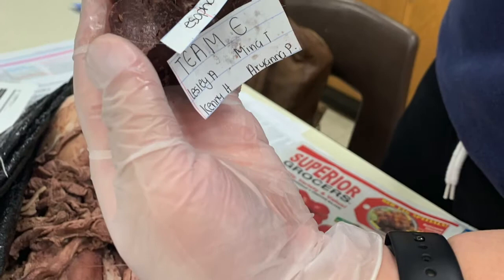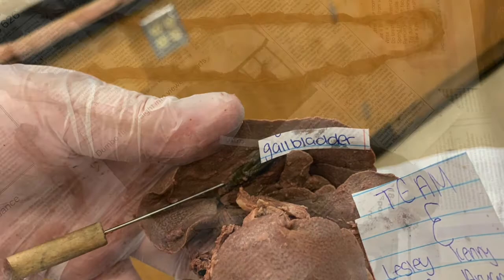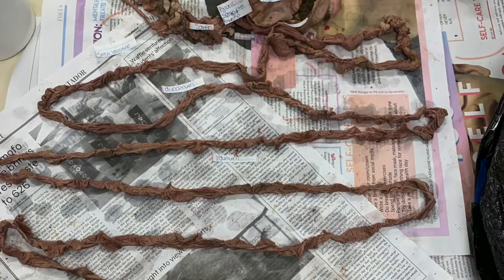The esophagus's function is to move food down from the mouth to the stomach. The liver functions to regulate blood glucose, break down fats, protein metabolism, store vitamins, destroy red blood cells, and remove toxins.